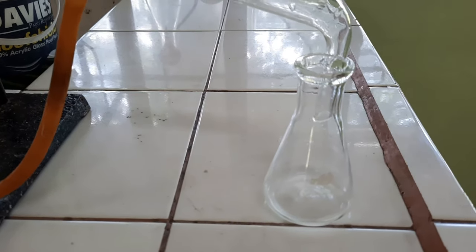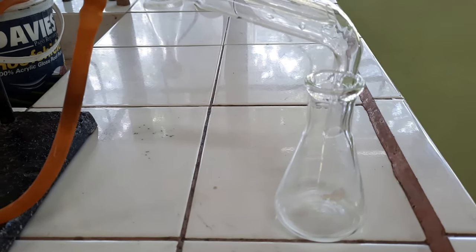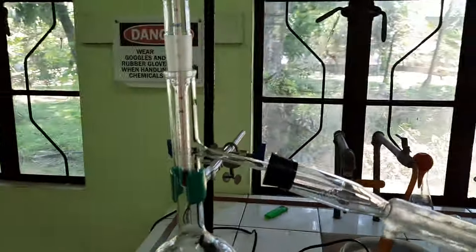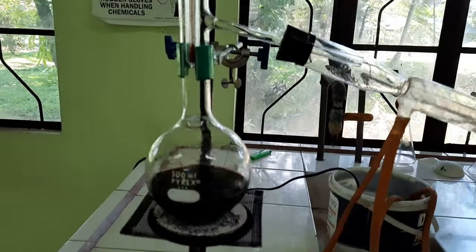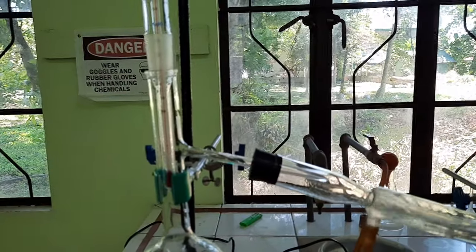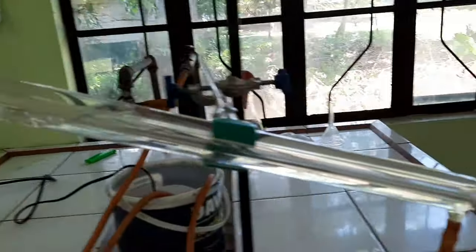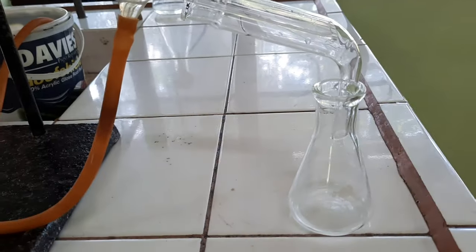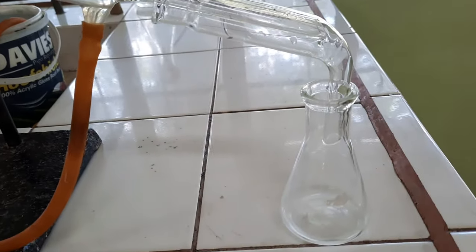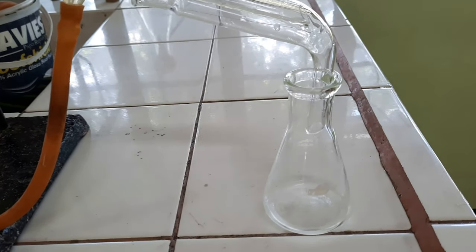At this receiving end of our distillation setup, alcohol vapor coming from the boiled wine vaporizes and eventually cools here to condense back into liquid alcohol. It is then distilled or received into this end of our distillation setup.